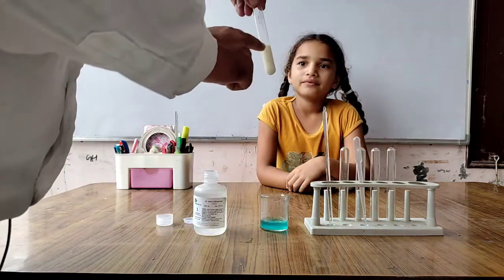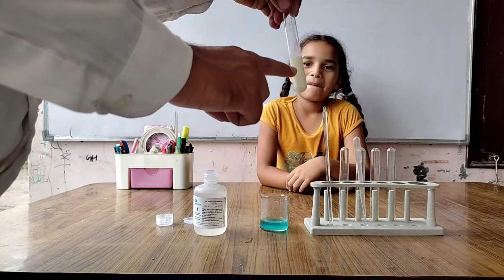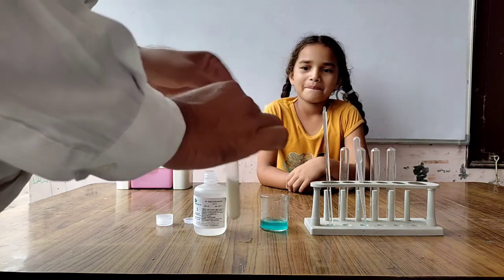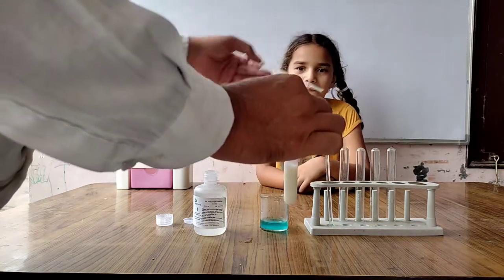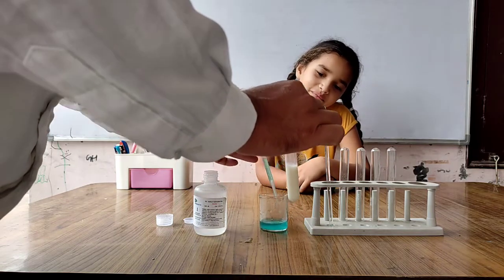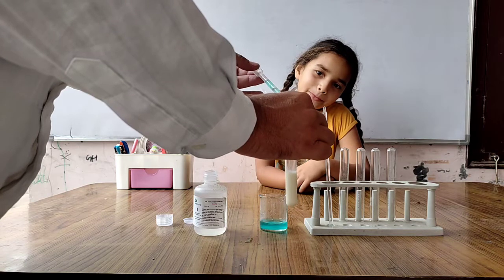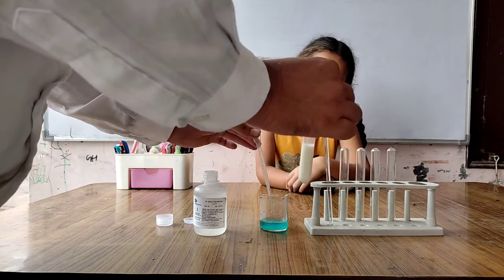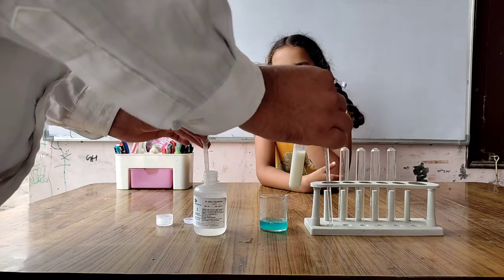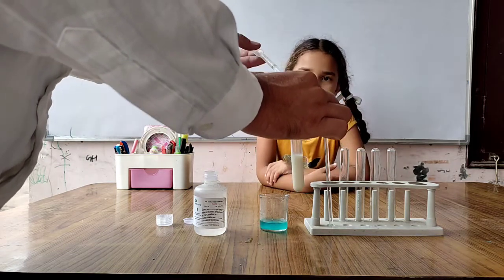What is the color of milk? It is white — we already know milk is white in color. Now I am adding two drops of copper sulfate with the help of a dropper. Two drops have been added.